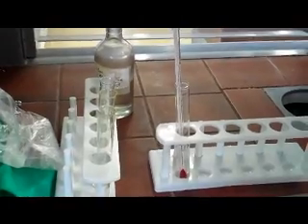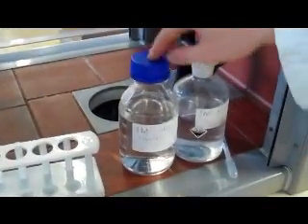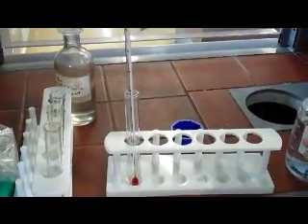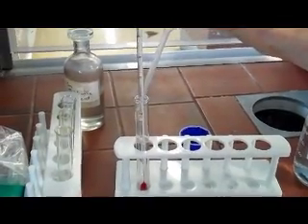Okay, Chris, what's the temperature of the sodium hydroxide, please? The temperature is 23 degrees. 23 degrees. Could you now add 5 ml of hydrochloric acid to your sodium hydroxide? This one? That's one. And if it's an exothermic reaction, the temperature will go up. If it's an endothermic reaction, the temperature will go down.